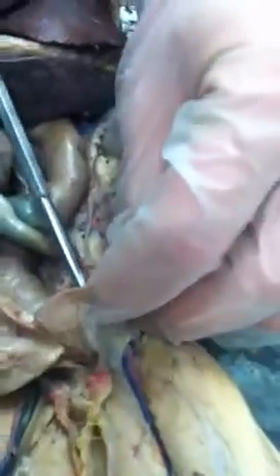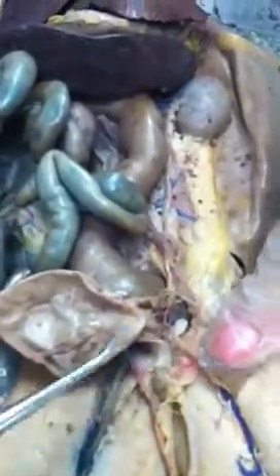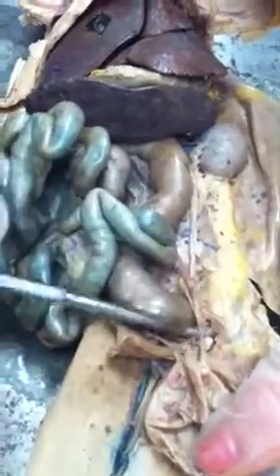And then the inguinal canal. It's the hole going through your abdomen. So this is the inside. It goes through. Inguinal canal. And then his vas deferens is right here. It loops over your ureter. So ureter, vas deferens, penis.